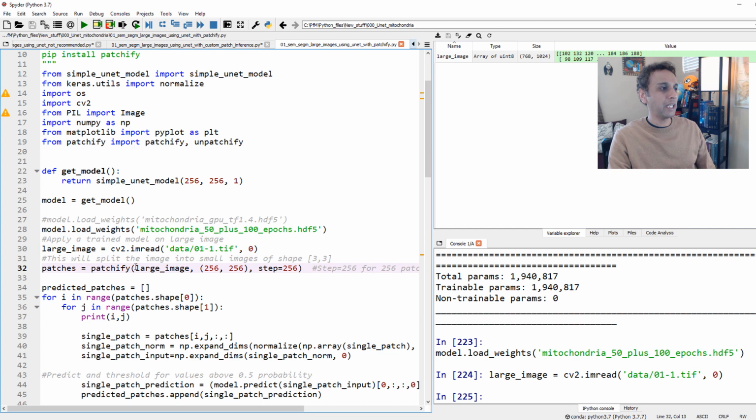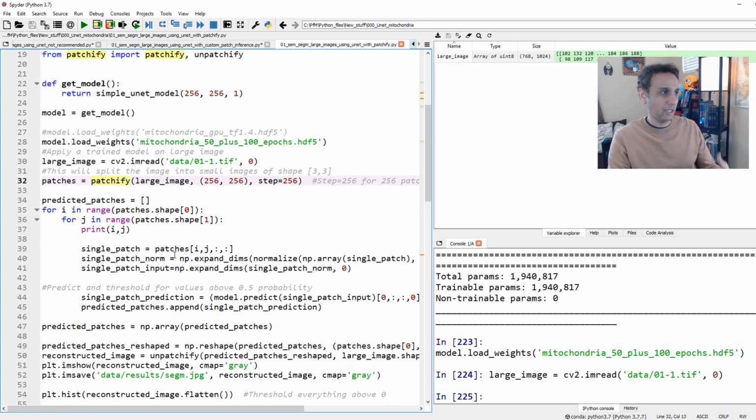And instead of me writing a for loop to take care of this, all I'm doing is, hey, my patches equals patchify, my large image, at a size of 256 by 256, and change the step size to 256. This is what I like about Patchify. It's very easy for me to change the step size. So I can change it to 128 and see how, when I put them together, the output looks like. I can change this to 64 and see how it looks. We'll do that in a second.